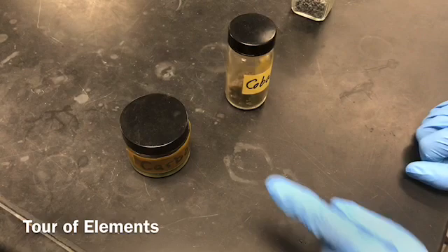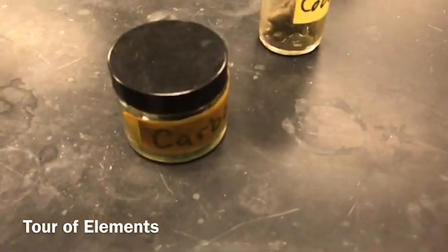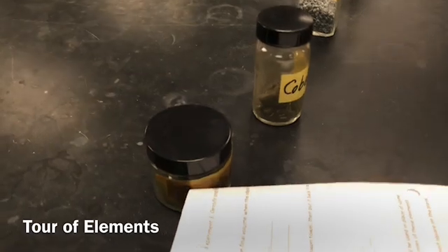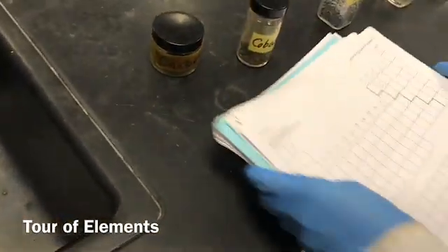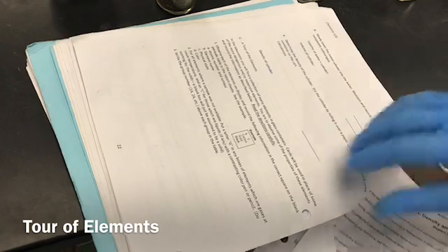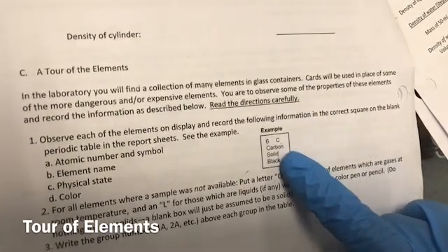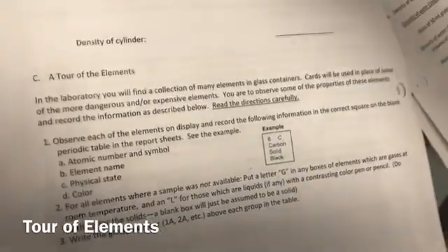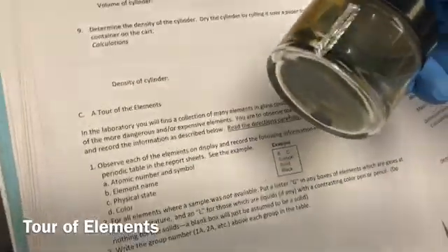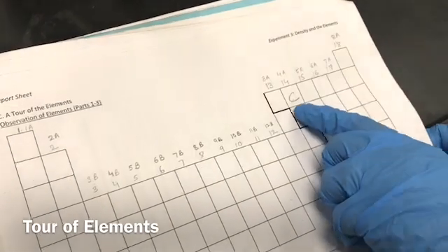Now we are going to work on the tour of elements. This is carbon. You are going to record information about each element into the periodic table worksheet in your lab manual. For each element, you will record the atomic number — for carbon that's 6 — the symbol, the name, the state, and the color. Carbon is a solid and its color is black. These are the properties you will fill in for each element's place on the periodic table.